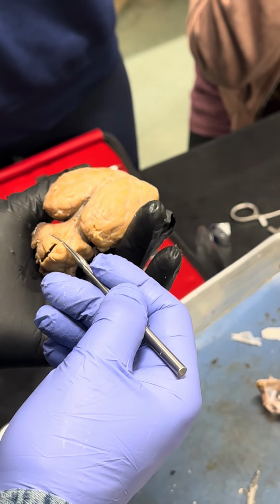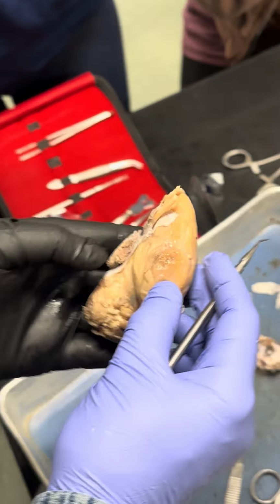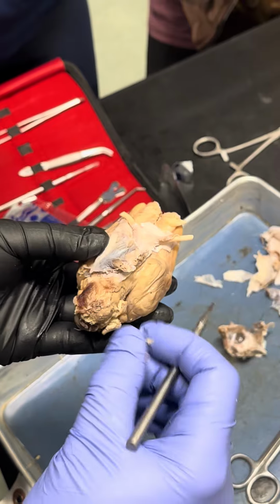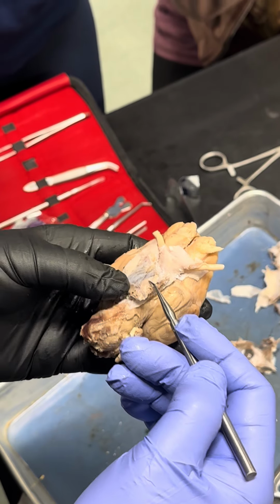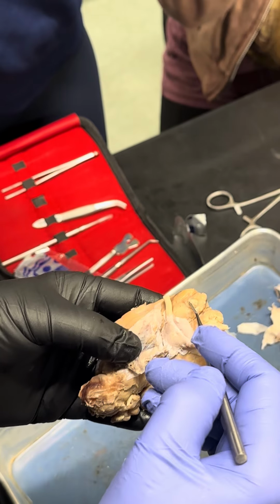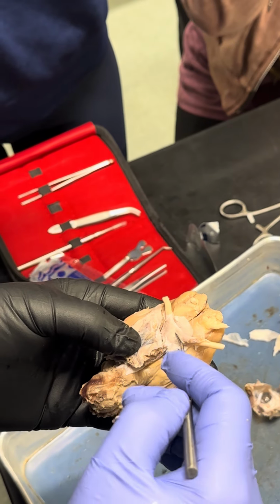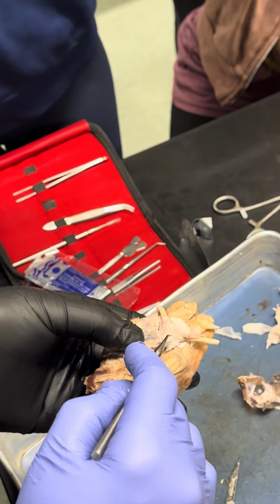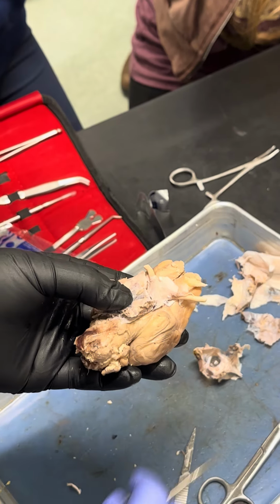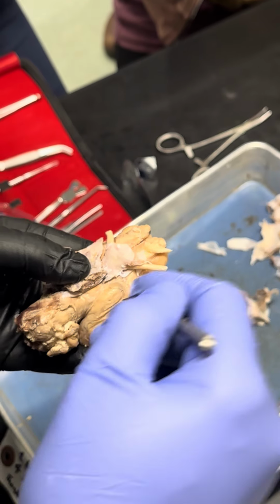This one is called cerebellum, longitudinal fissure, transverse fissure. Okay, and in the inferior surface you have the pituitary gland here. This is the pituitary gland right here. This is the olfactory nerve. This is the optic nerve. When the nerves crisscross, this is called optic chiasm, and it becomes optic tract. It goes inside the brain.